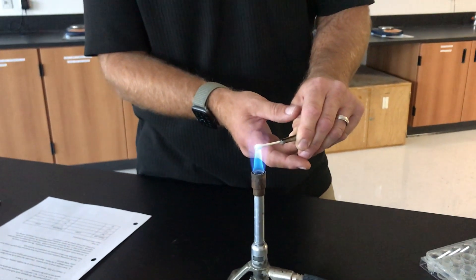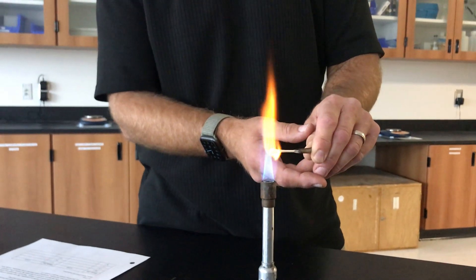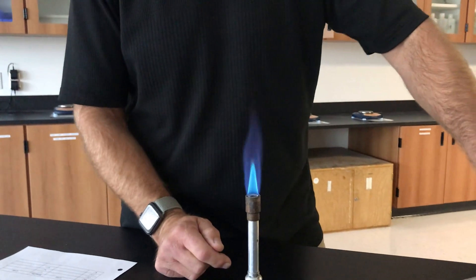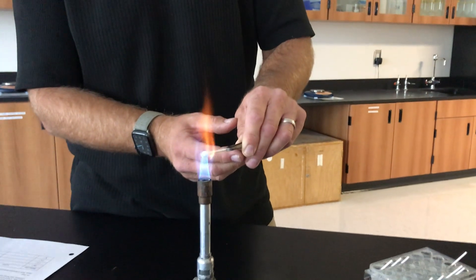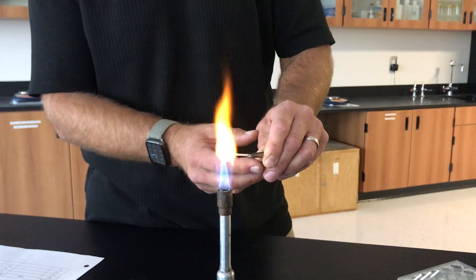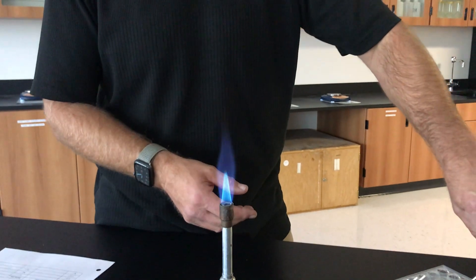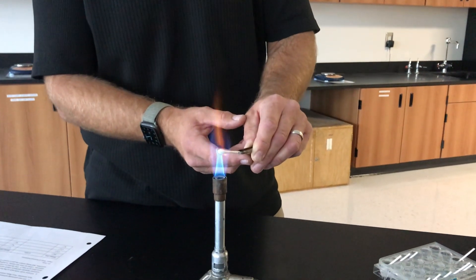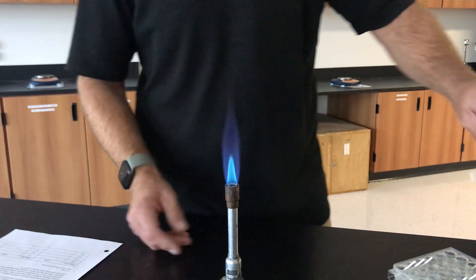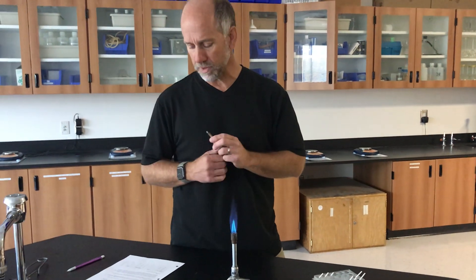This is our barium, and that is the color that is representative of barium at the tip of this flame. We will re-dip and come back — that is the color that's indicative of barium being flame tested. Be careful that you don't confuse it with the orange at the end when the Q-tip actually catches on fire. Take a second, pause the video if you need to, and record that color in your data chart.